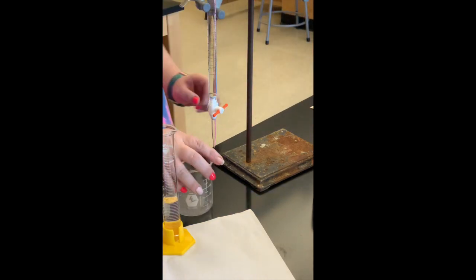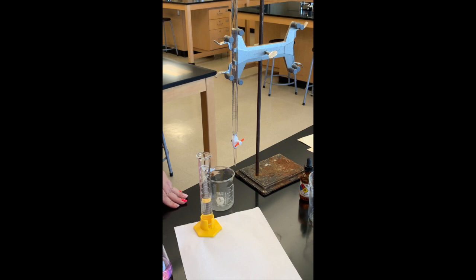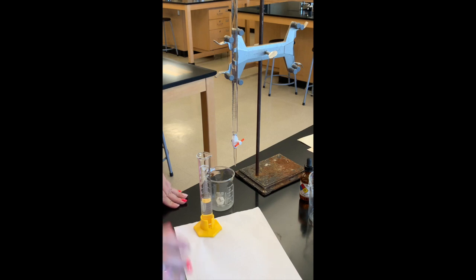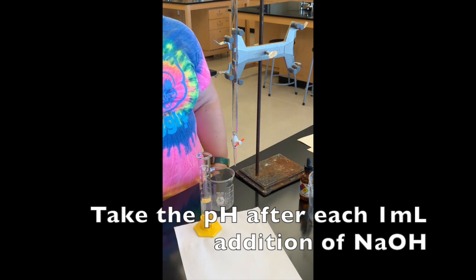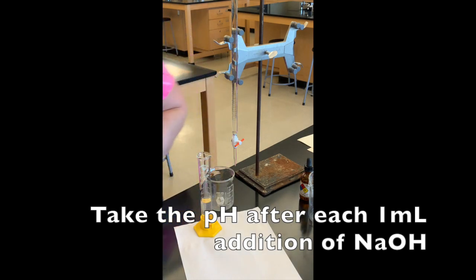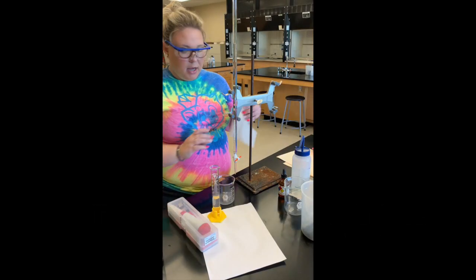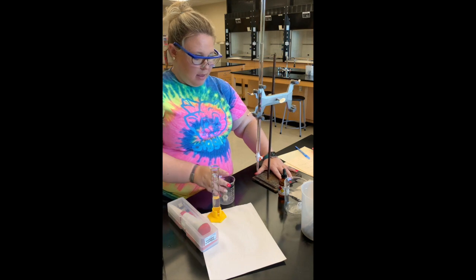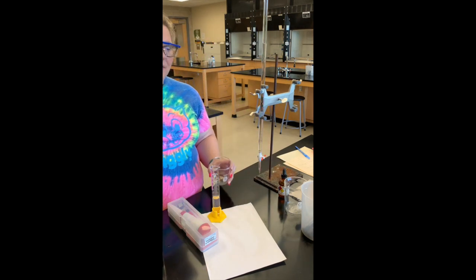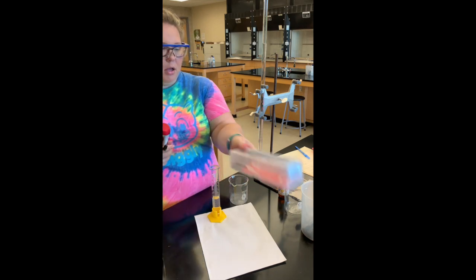This time I'm going to titrate into a beaker instead of a flask like I did for Part B. In Part C, after each milliliter of sodium hydroxide added, I'm going to take the pH. I have a pH meter here, and I'll also need distilled water, so I have that squirt bottle here.